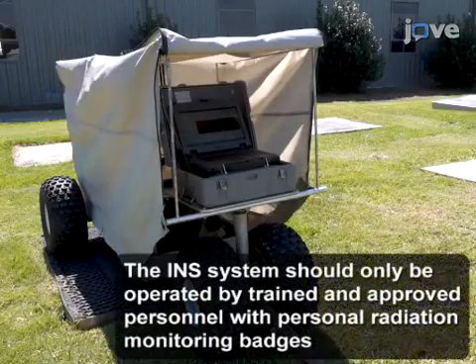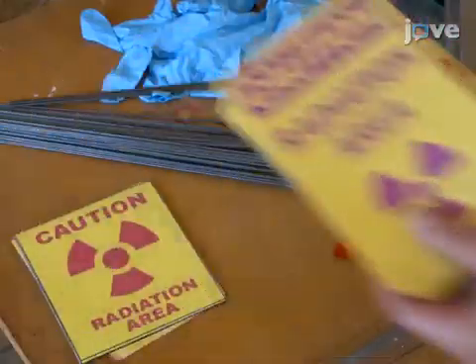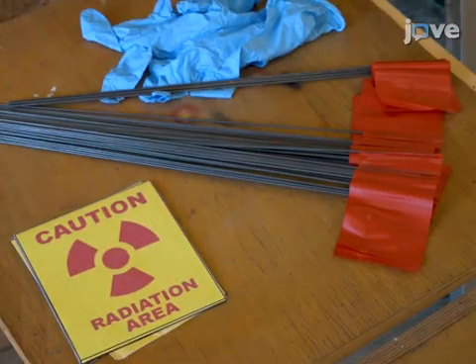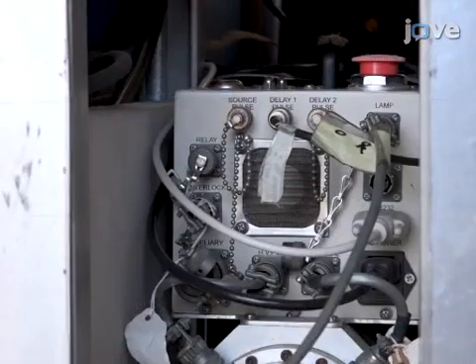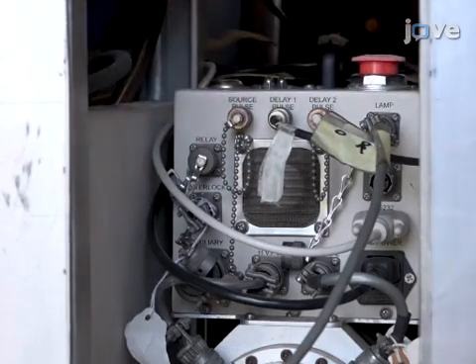Before working with the INS system, obtain materials for designating a restricted area around the neutron generator. Verify that the neutron generator emergency interrupt button is unobstructed.